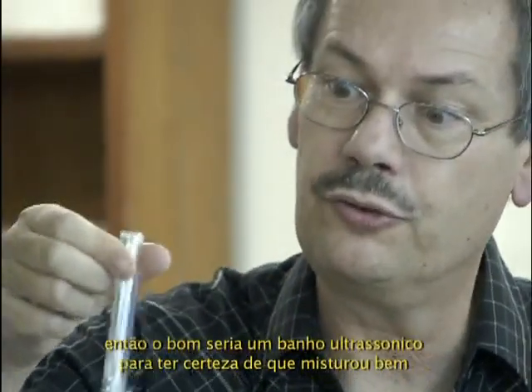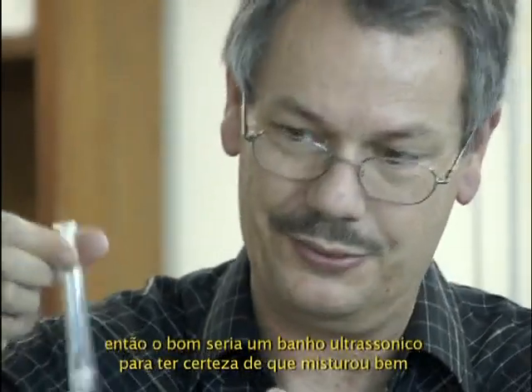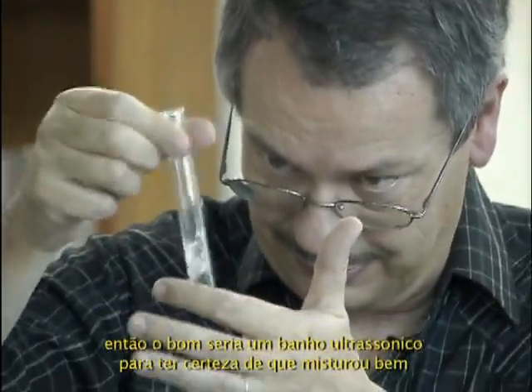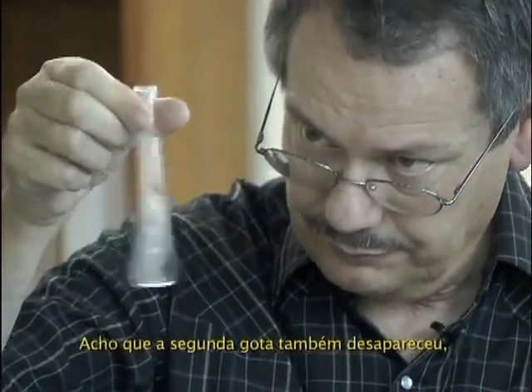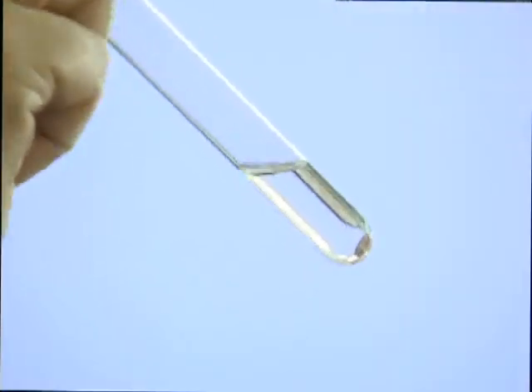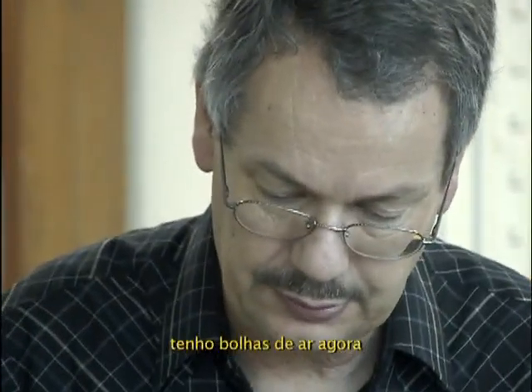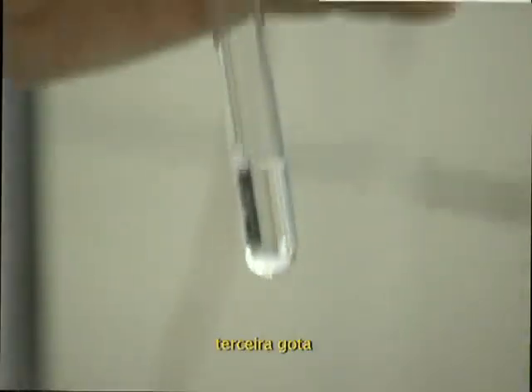So a good tool would be an ultrasonic vibrating machine to be sure you mix it very well. I think the second drop disappeared also. Yes. Third drop. I have bubbles there. Third drop.